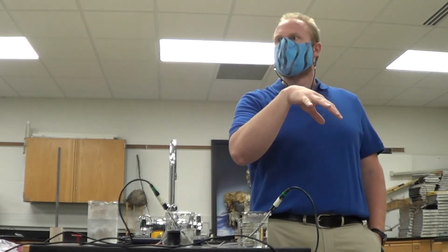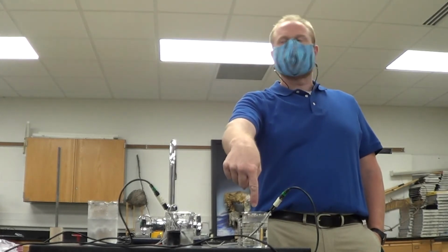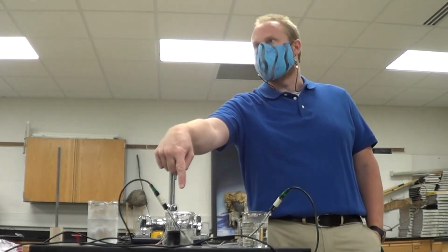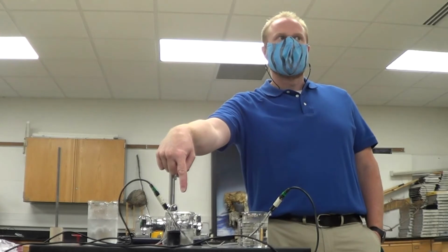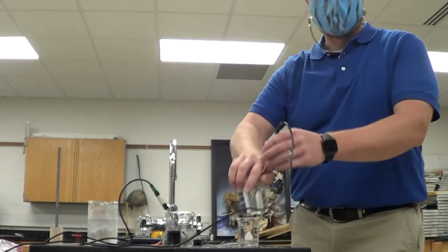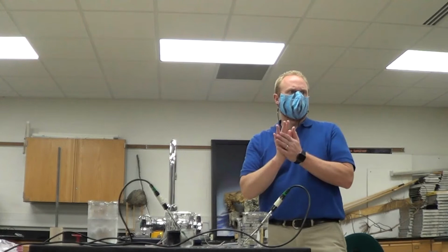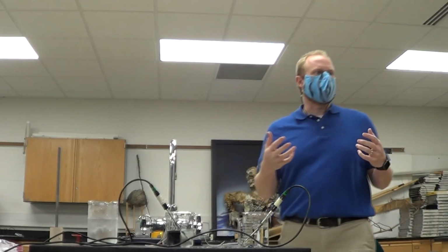The hot water one, 37, is dropping a little bit now, compared to like 8. We're creeping up to 9 degrees right now in the metal. So it's going up a little bit, but definitely the hot water one, ooh, that was close, I almost spilled it completely. The hot water one definitely raised the starting temperature much higher. Water has a high specific heat value.